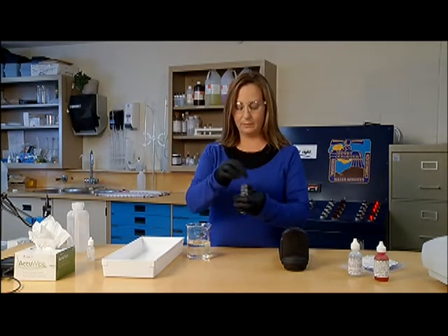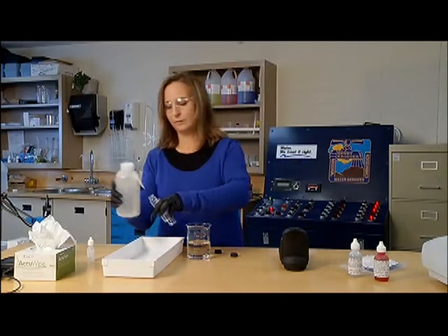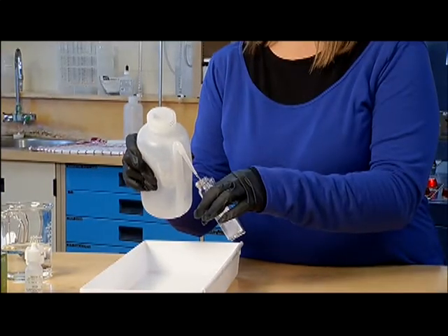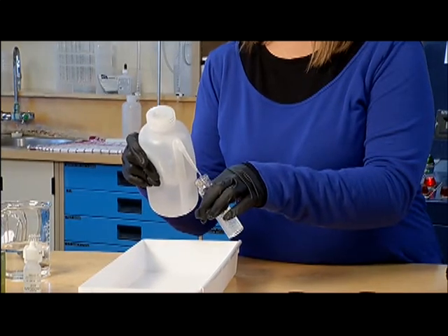In this illustration a treated water sample beaker is used. Some methods indicate sample collection in acid-washed plastic bottles. Check specifics against your operations program.